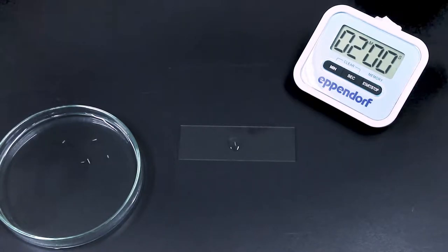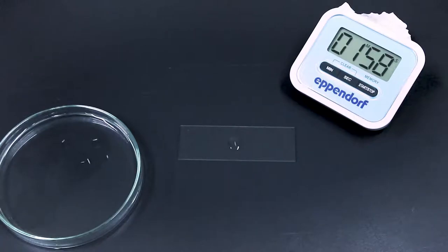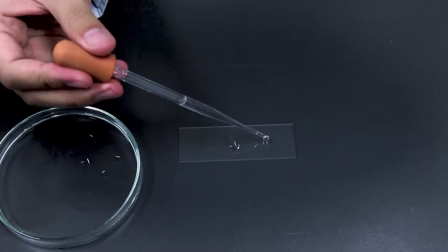At this stage the cell wall is going to be broken by the acid that we add, and we want to have a look at the chromosome inside the cell. So we break the cell wall by the hydrochloric acid.